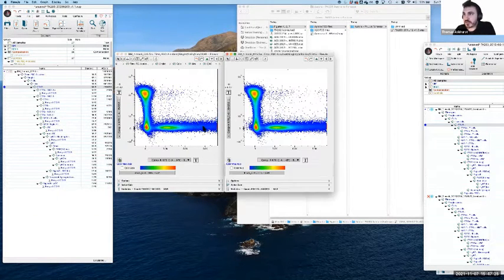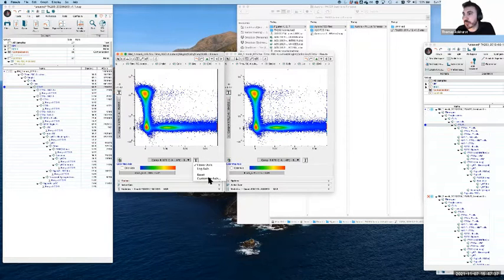I can't have the bi-exponential open next to it, but hopefully what you can see here is that if this axis is linear, the majority of the data is low down, and then there's this really long tail as they start to get higher and higher. I'll probably expand this out a little bit.